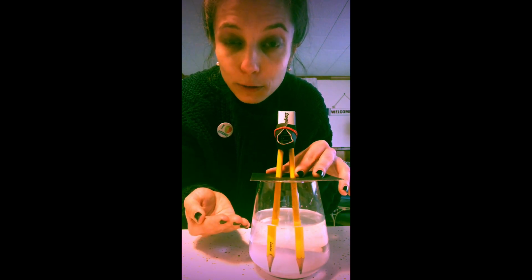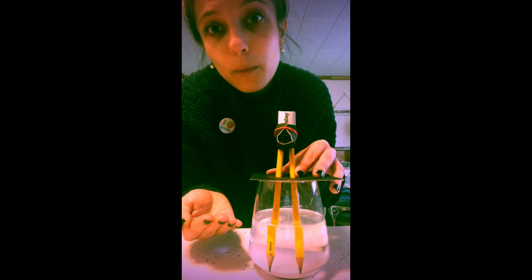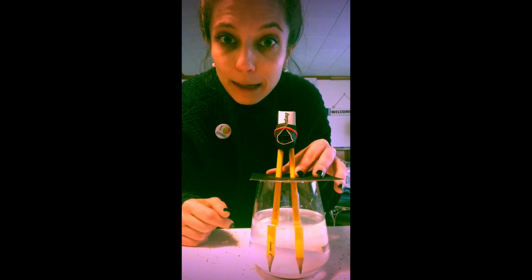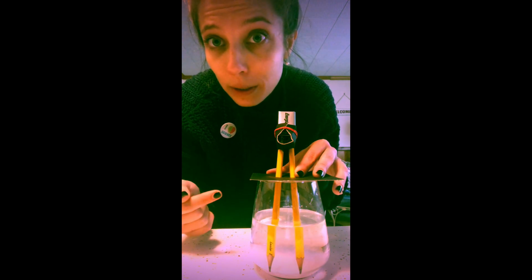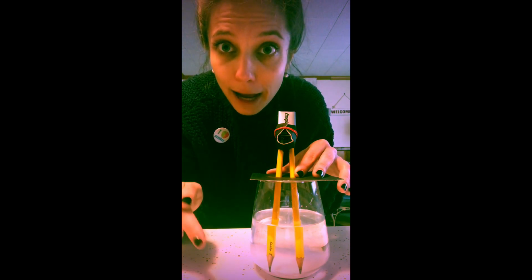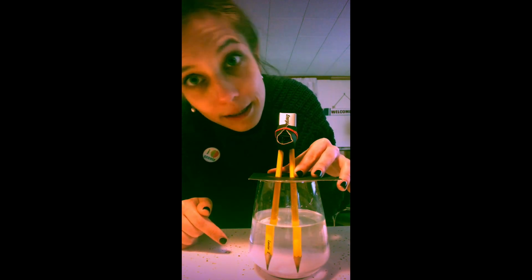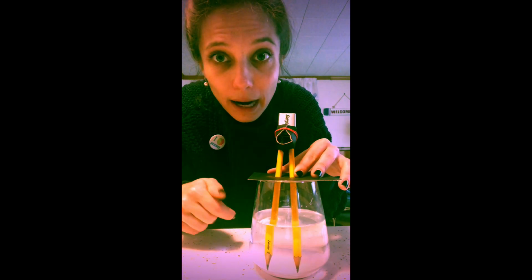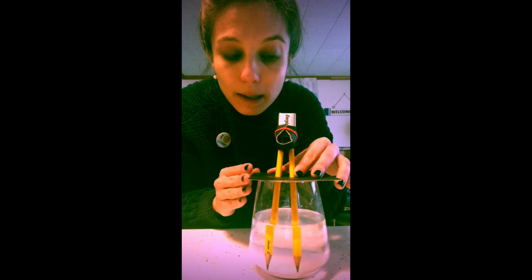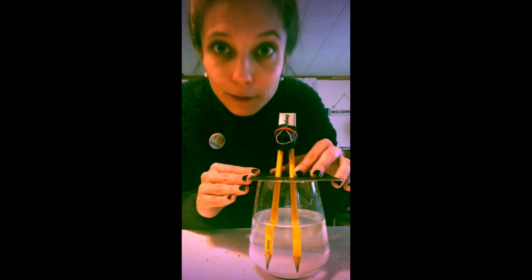Because we're making a solution now, a mixture of NaCl and H2O. We're going to start to see that chemical reaction take place, and we're going to know what's happening because there's going to be bubbles, either hydrogen gas or oxygen gas, escaping from either end. I'm going to put this somewhere to film a time lapse as it gets going, and you can check that out next.